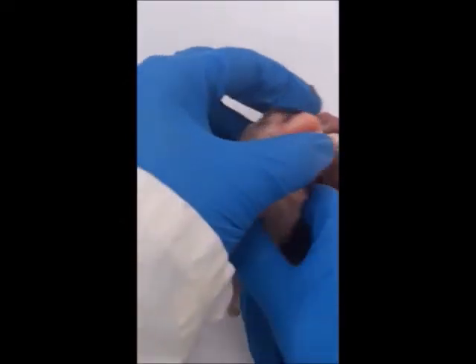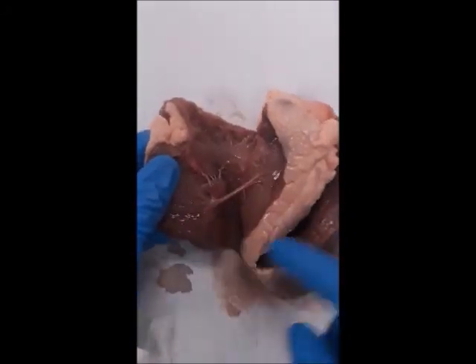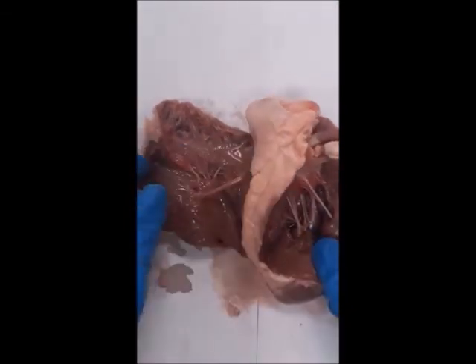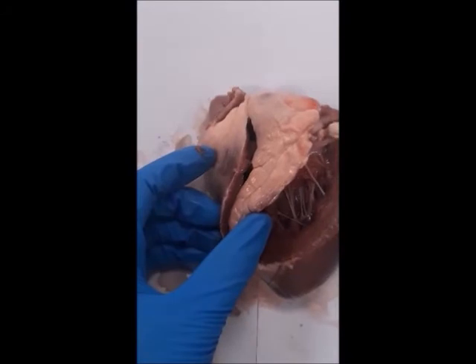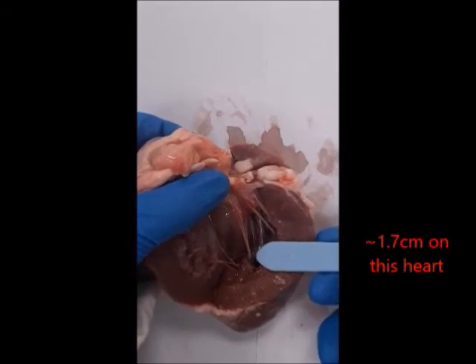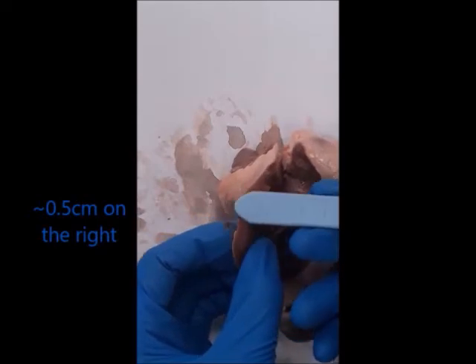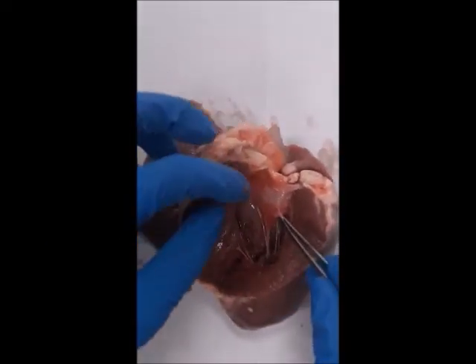You can see there's a clear atrium at the top and the ventricle at the bottom — same on both sides: atrium at the top, ventricle below, with the septum running down the middle. The last feature we'll look at is the myocardium, otherwise known as the chamber walls. On the left-hand side it's much thicker than on the right, because the left side pumps blood out to the entire body, not just back to the lungs.